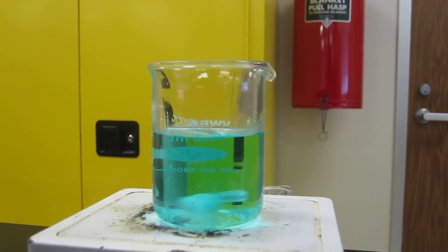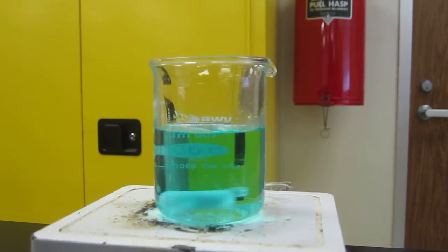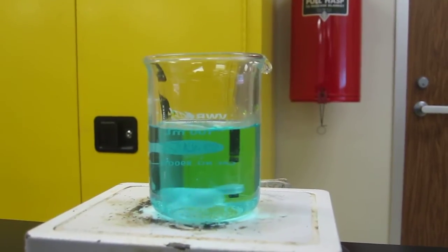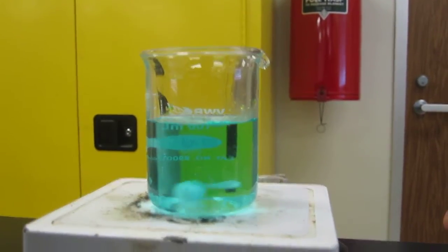Okay, here we're showing the displacement of copper in an unknown copper compound by the magnesium turnings here.